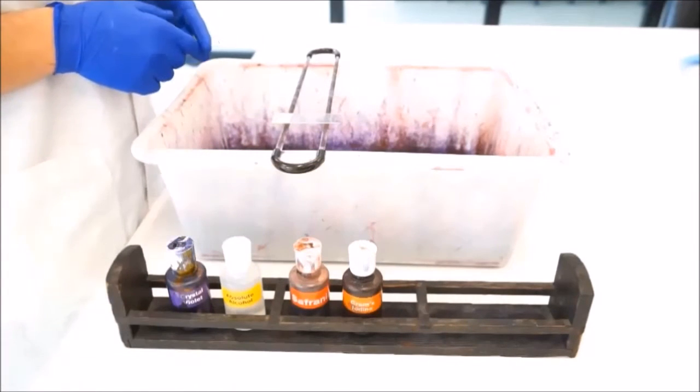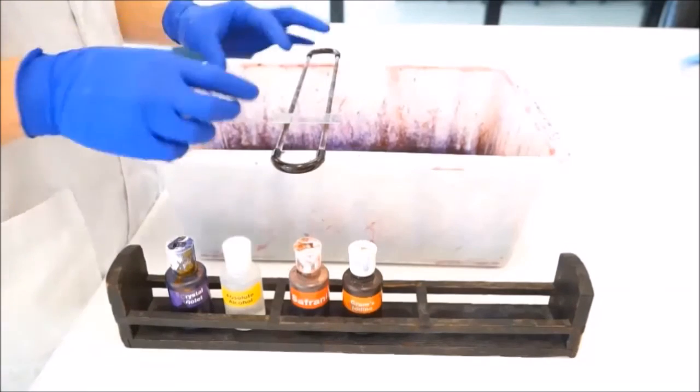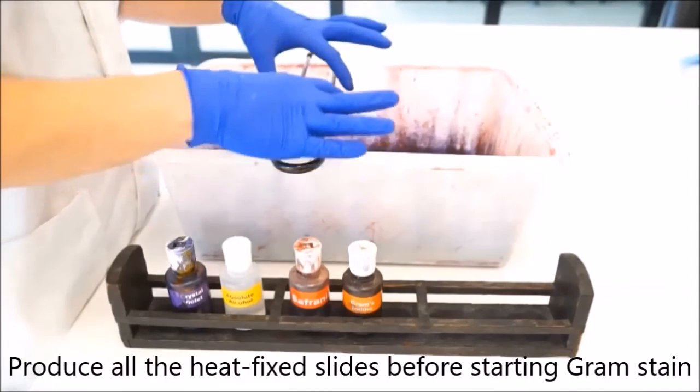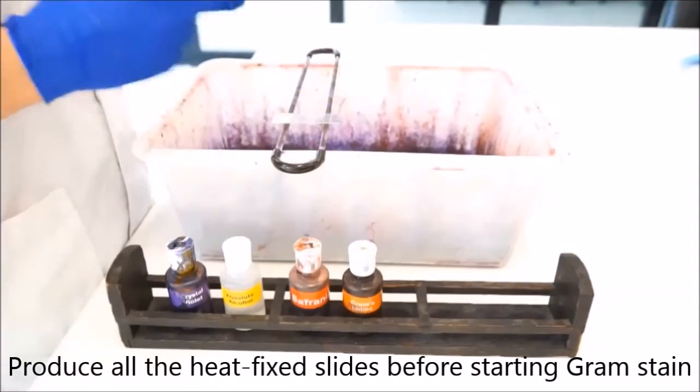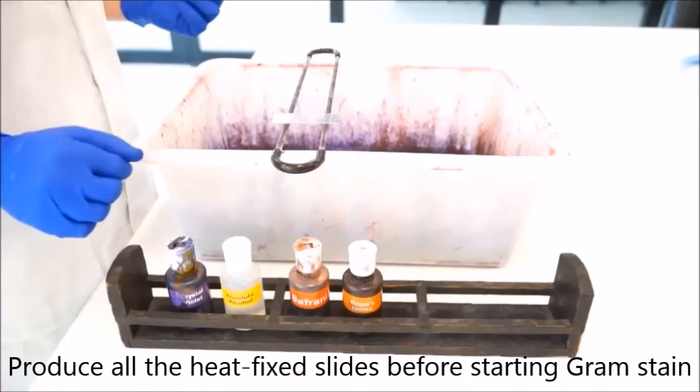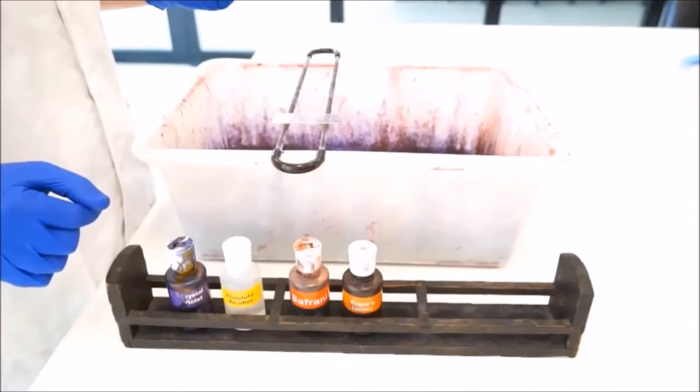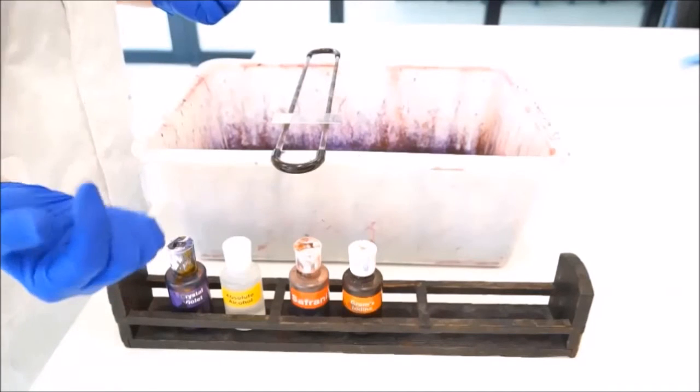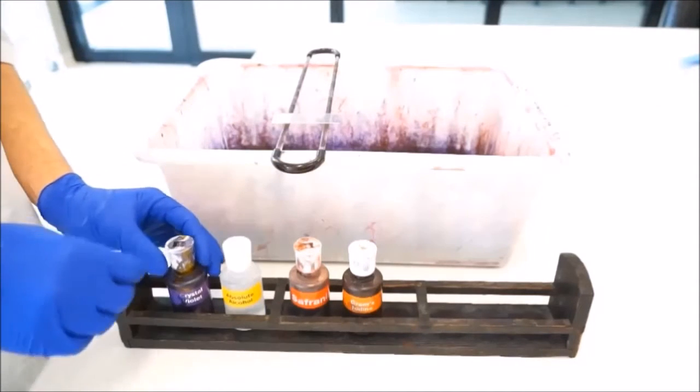Now if you've got more than one slide to process, I'd get them all done and have them on this apparatus here and process them all at once. You should have a protocol in front of you and you can follow that. I'm just going to show you basically what to do.